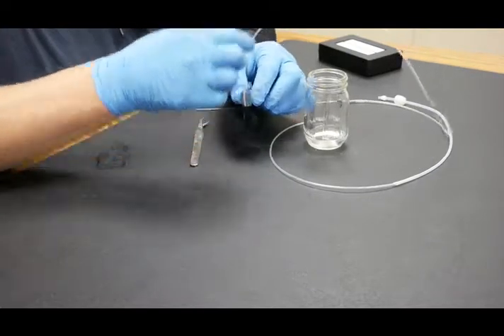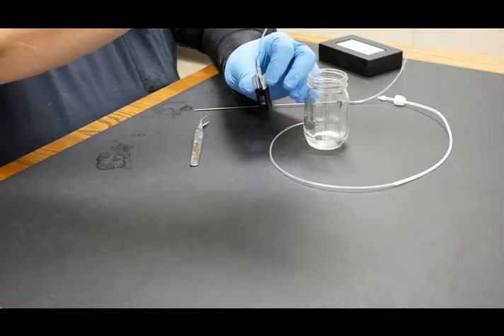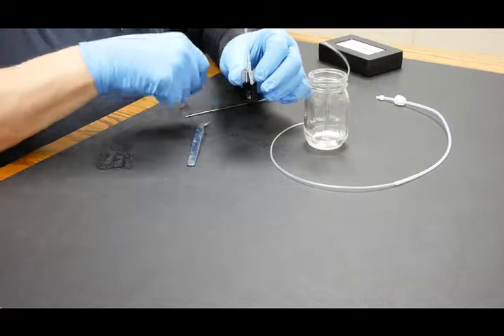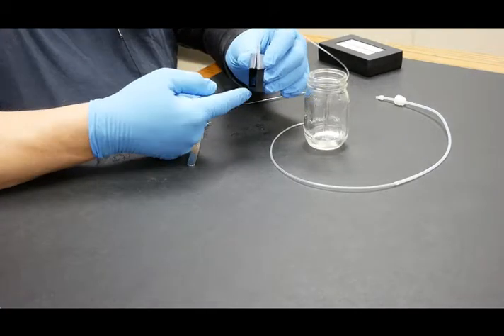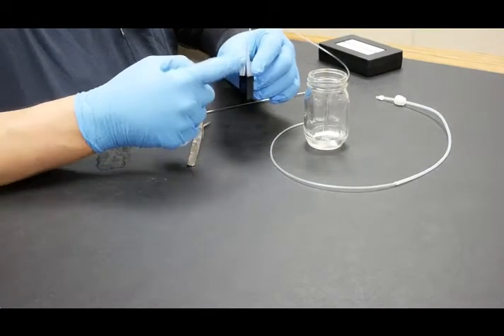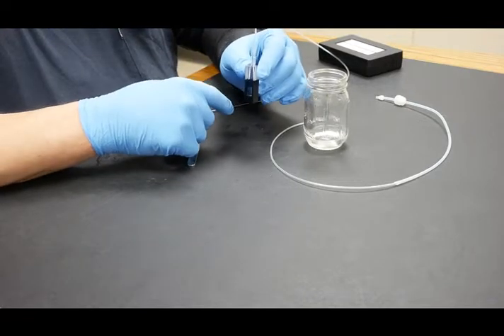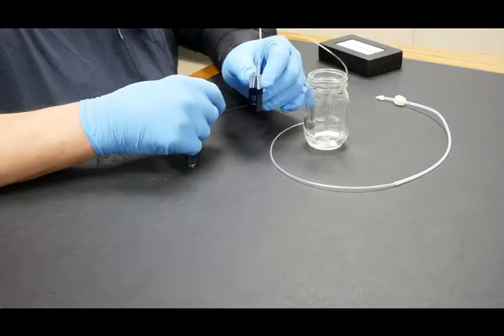We just want to make sure that the tube to the right is the one attached to the probe and that is the tube that feeds the bottom of the cell. If it's tubed the other way around, bubbles will get stuck in here and they will not clear out, so you'll have to replace the tubing.